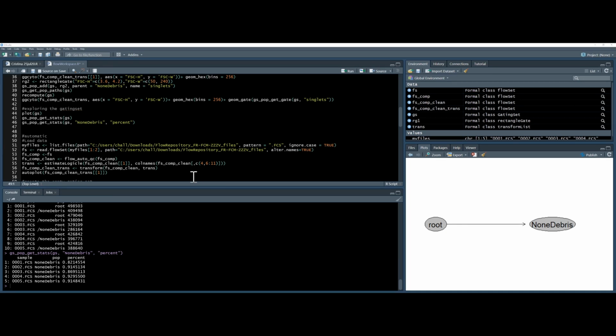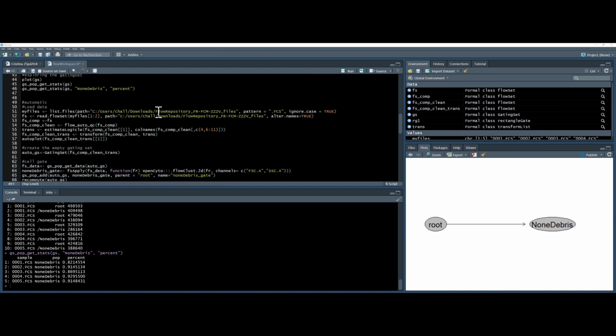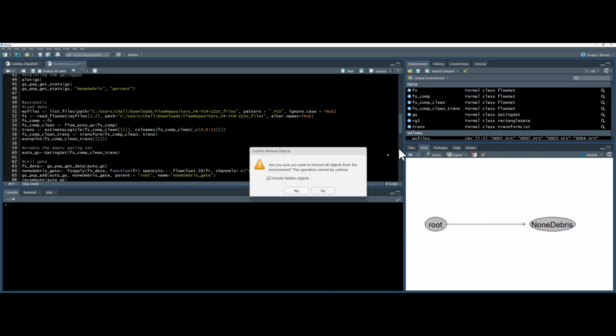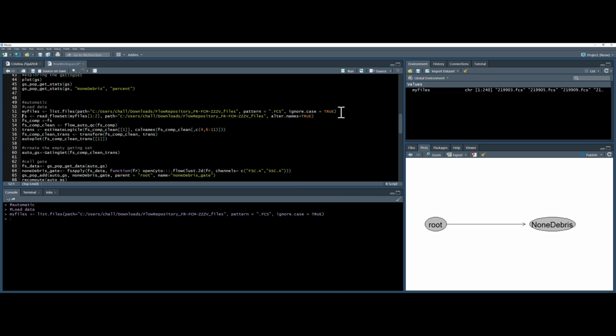Okay, let's look at automated gating. What I didn't say earlier, by the way, is I'm using files from FlowRepository again. You can find links to these in the bottom, as well as a link to the script that I'm using now. So we're going to do some automated gating, exactly the same as we did before by loading the data. So I'm just going to clear my workspace to make it simpler for you by using the little brooms. And I'm going to list my files and load them to a flow set.